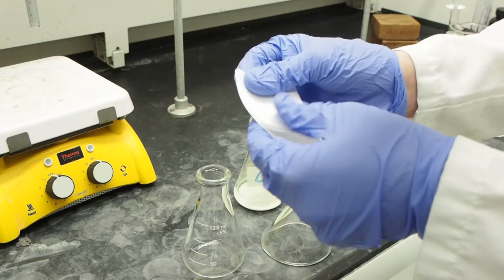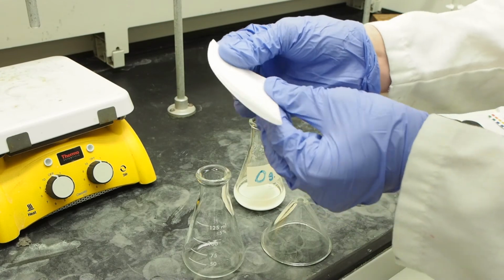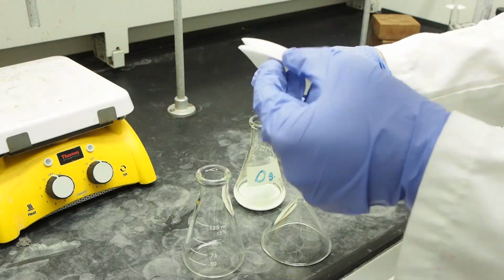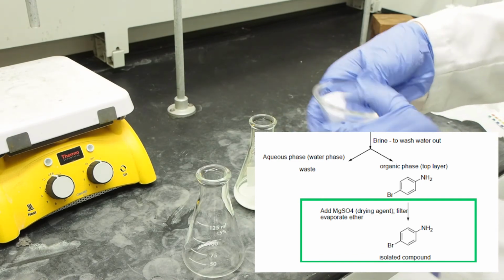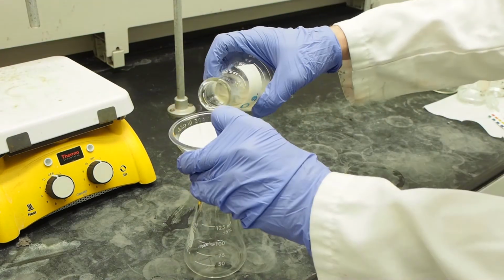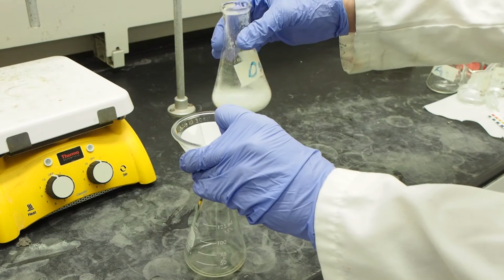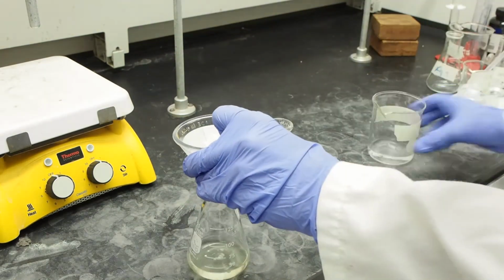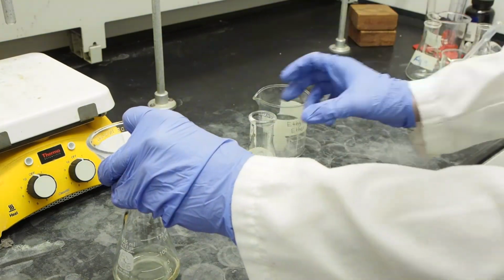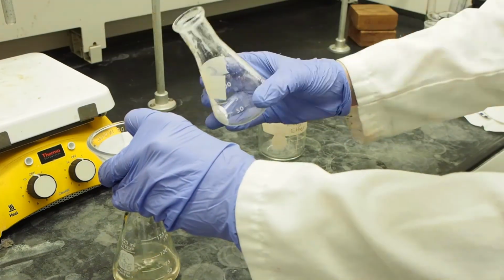Now let's work on the ether solution of 4-bromoaniline in the flask labeled ORG. Remove the drying agent from the flask through gravity filtration. Rinse the ORG flask with ether 2 times. Collect the filtrate into a pre-weighed flask, a round bottom, or an Erlenmeyer flask. Evaporate the ether as directed by your instructor.